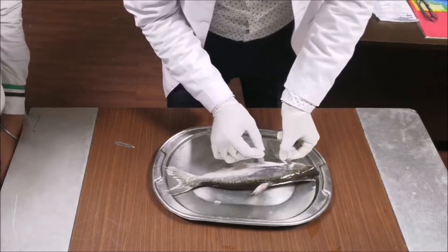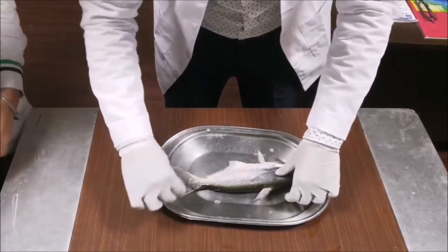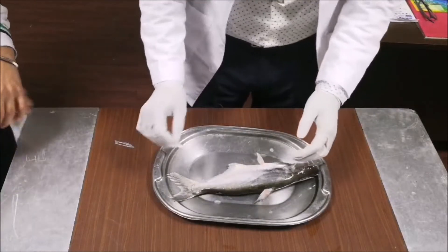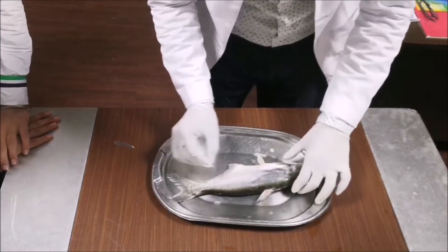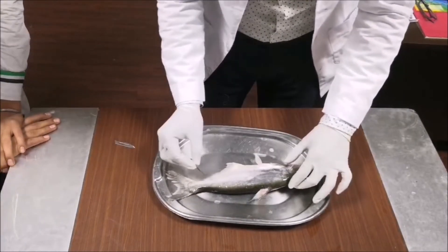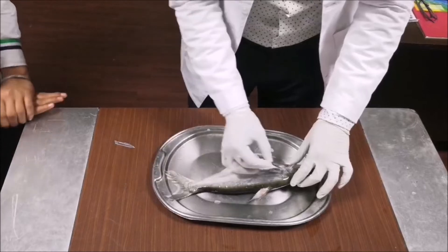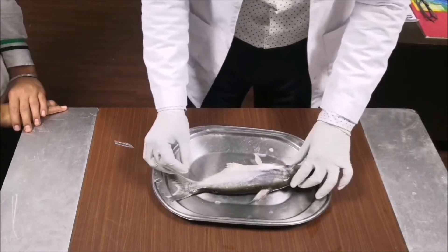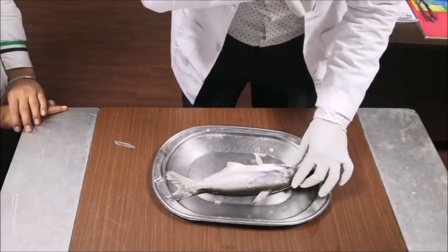Every fin has some bones, so this is the bony structure which helps them to move. Can you see this line? This line basically helps them to experience the vibration and sense the danger. This line also helps them to swim as well.